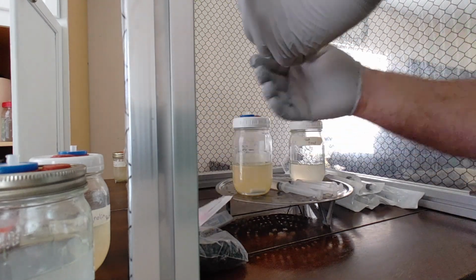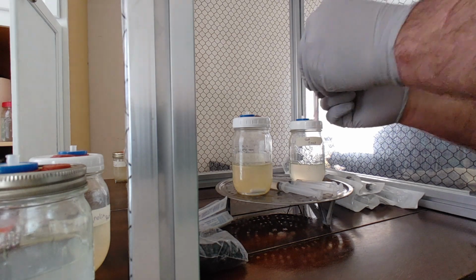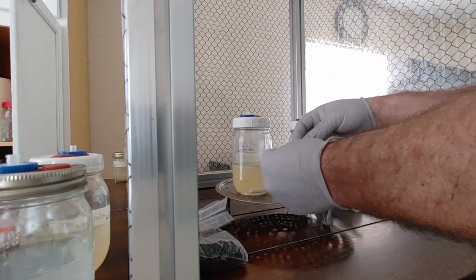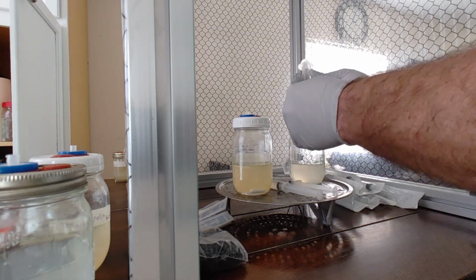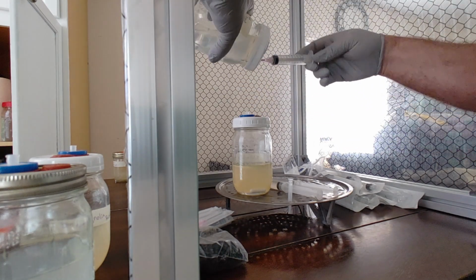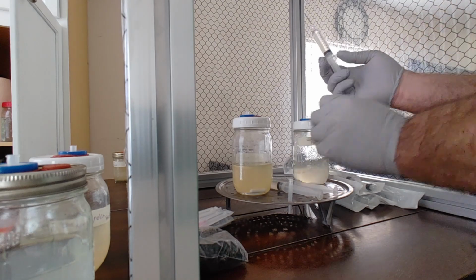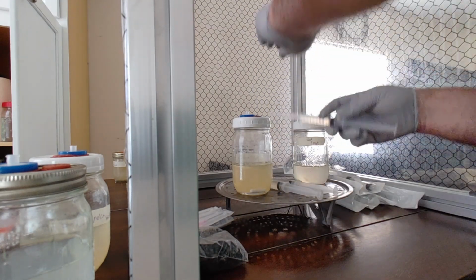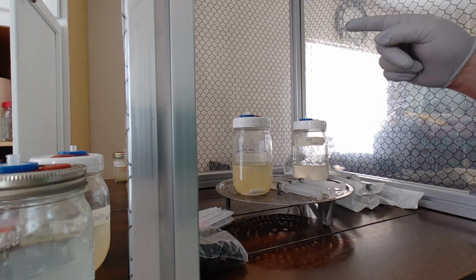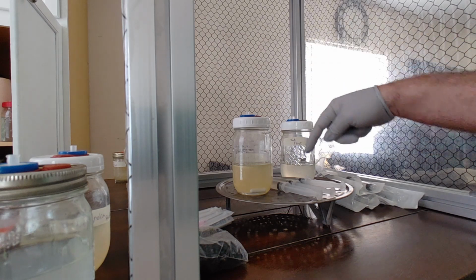One more time, just in case you didn't catch anything the first couple times. And cut. All right, that's how you draw. Always make sure to stir it up real good. Always tilt your jar so that your needle's inside the LC. Draw it up, cap it.